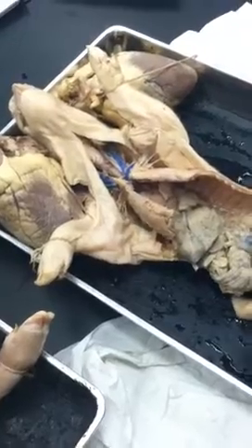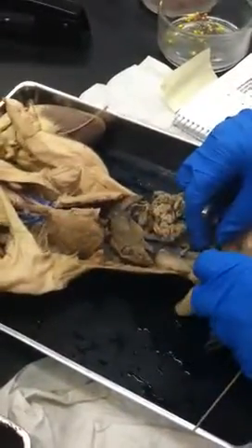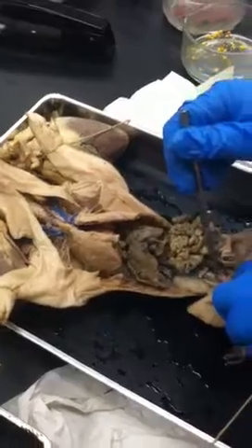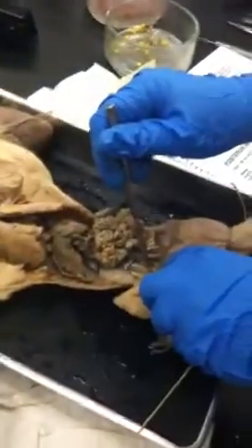On this guy, it's this first one here. And I'm not seeing great veins in any of these, but look at the clear tubes underneath the arteries. Yeah, looks like this guy.